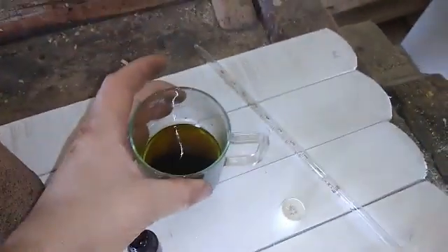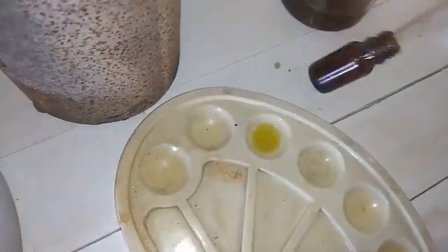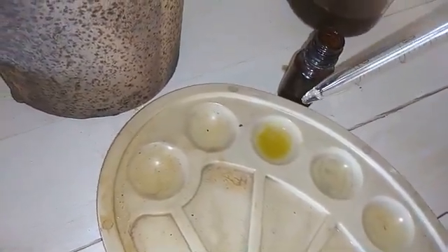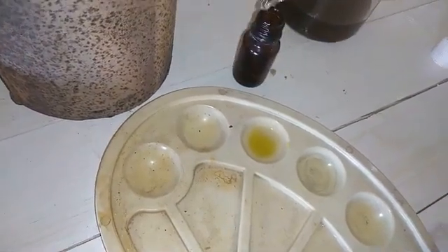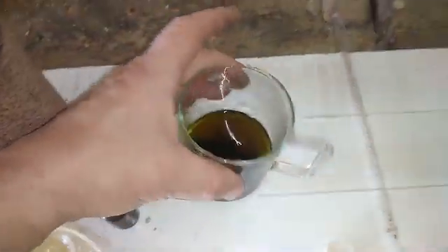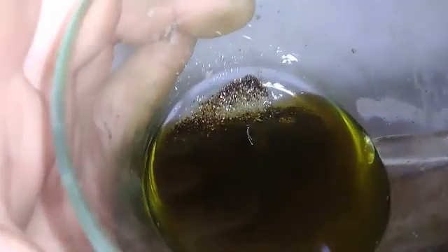Really, I don't know what this is. Just for you to see the result — I dropped some of the dissolution here. I got my stannous test here. If there's any noble metal it should show on the test. When I drop the stannous test, I have nothing. Zero. So this is just normal aqua regia, and the flakes are still there — untouched.